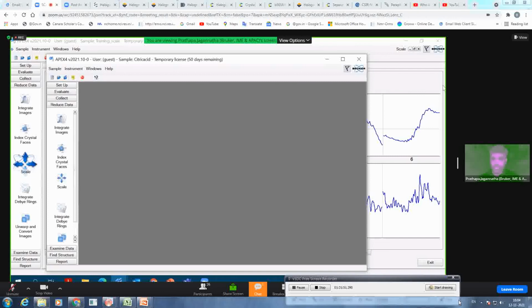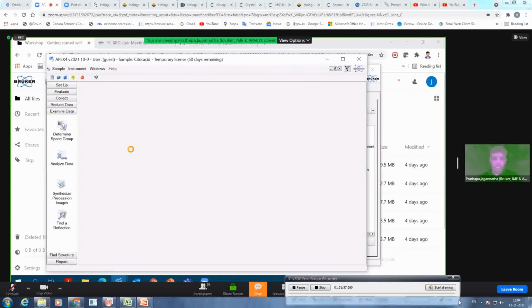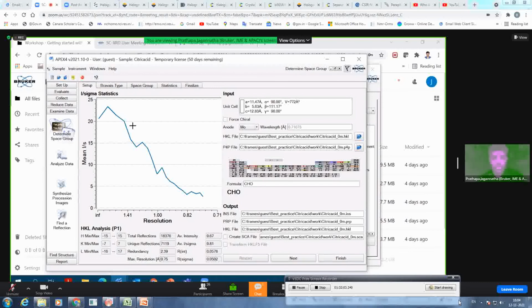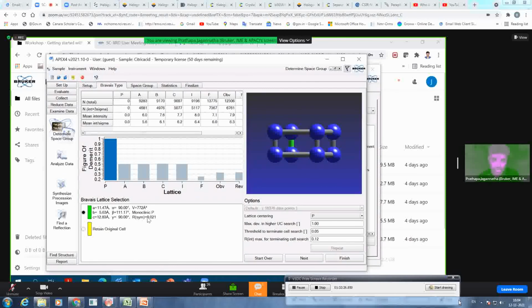scaling. So the next step is I just want to take you through the determine space group plugin. Yes, we have got the determine space group plugin. So now it is more informative. You get the quality of your intensity for the reflections for overall data, and you get the information about total reflections. And then you can get this formula or the periodic table. You can add that into your formula directly. And now you know this is a monoclinic P, and it is represented here with a monoclinic unit cell with P centered, meaning all the atoms sitting at the corners.